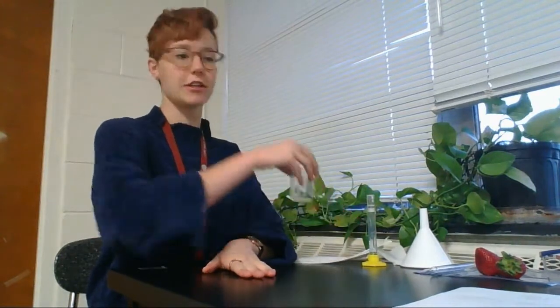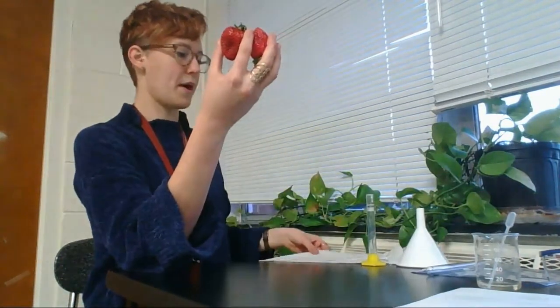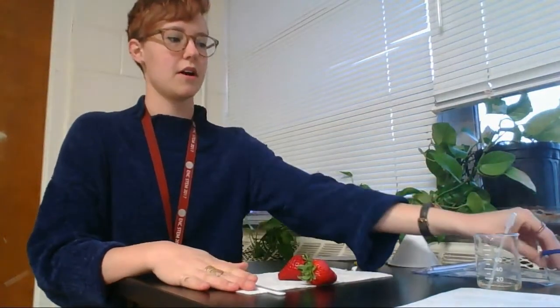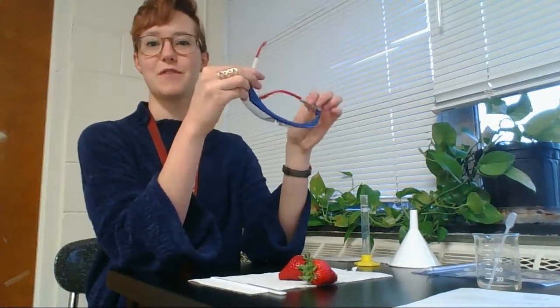Once you're back to your station, the first thing you're going to do is take your two strawberries, your paper towel, and your plastic knife. Before I start cutting anything, safety first, take my goggles, put them on.